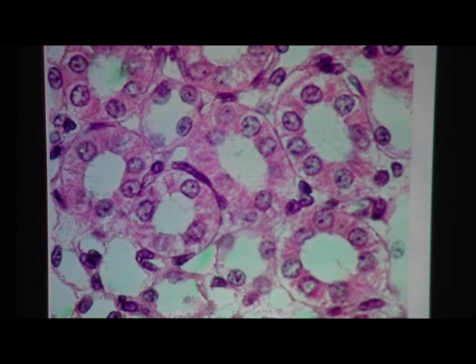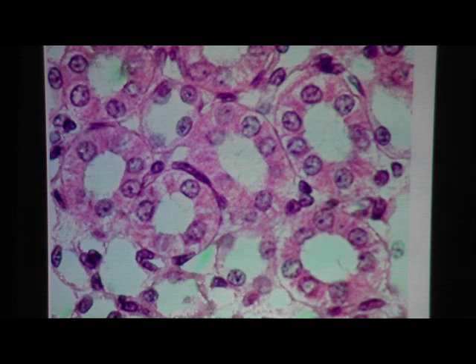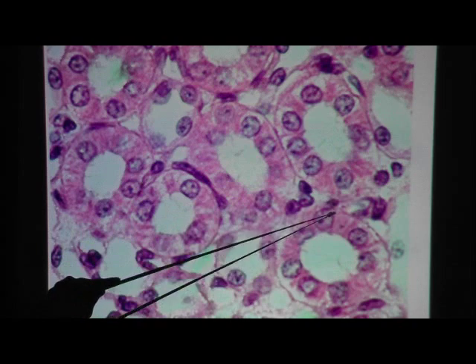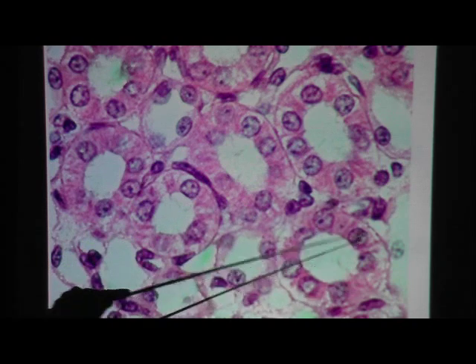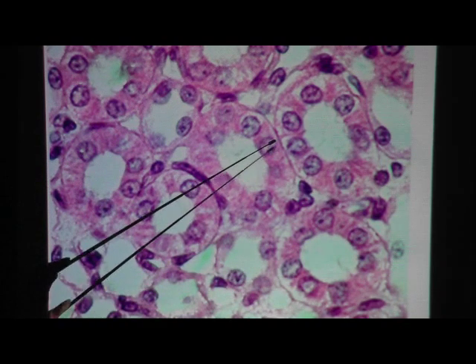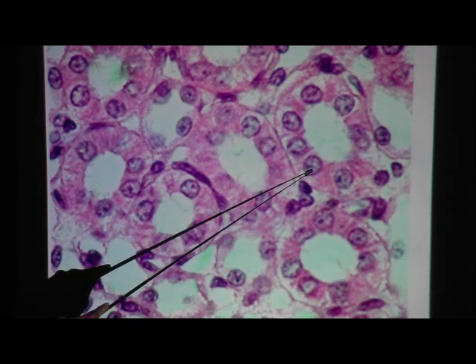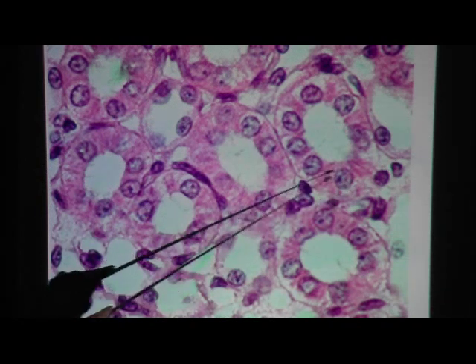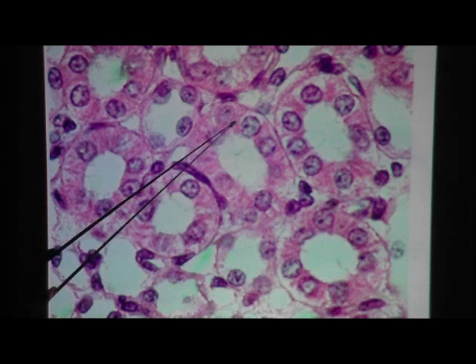Here's another simple cuboidal epithelium — they're arranged like rings. Simple cuboidal epithelium with nice round nuclei and cytoplasm visible in each cell.